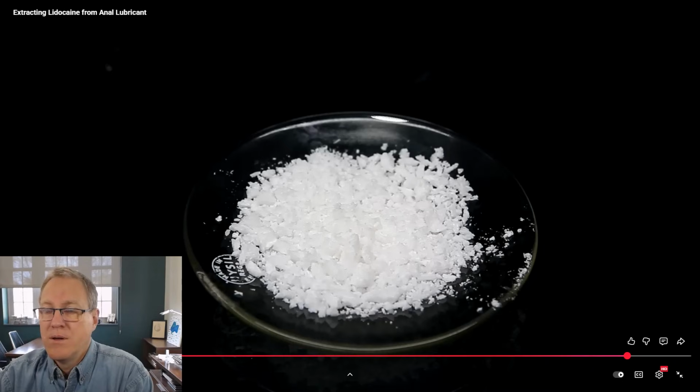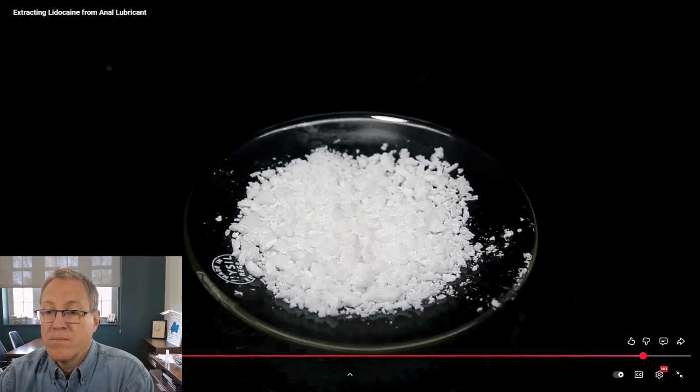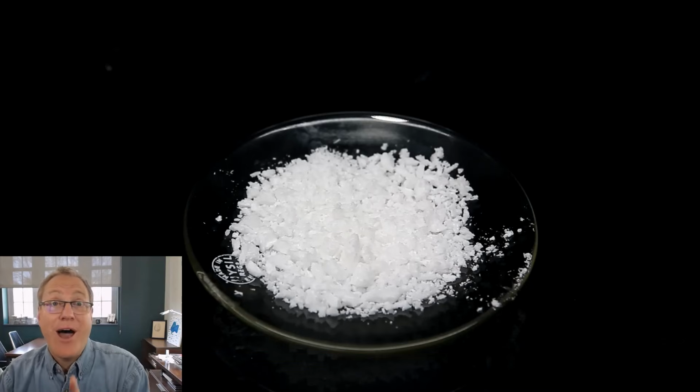To make the extraction the most time efficient, you really do want to work with the highest concentration possible. Also, the biggest tip that I can probably give is don't try to do any extractions using organic solvents. I've tried this, and it really just makes impossible emulsions that never separate. How many extractions did he have to try to bring this video to fruition?